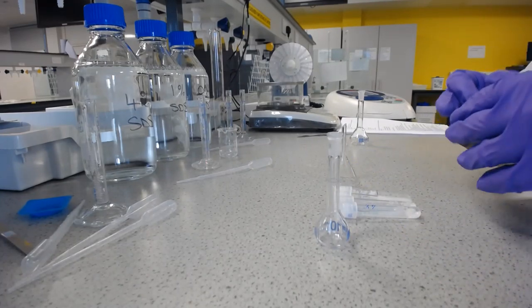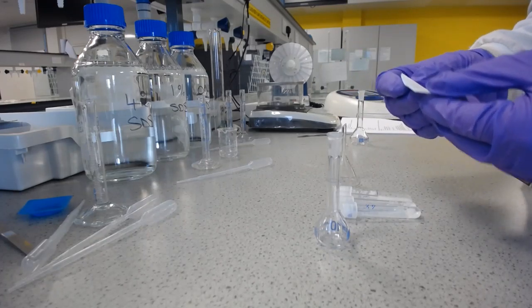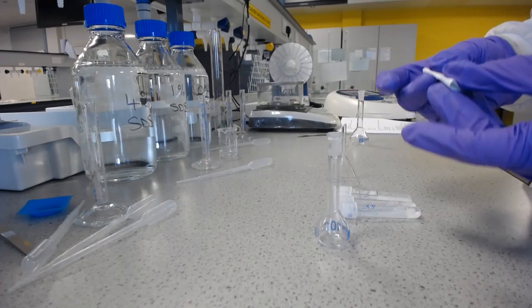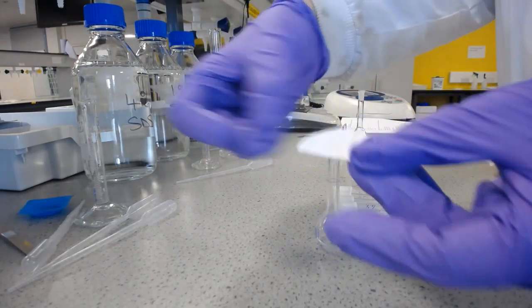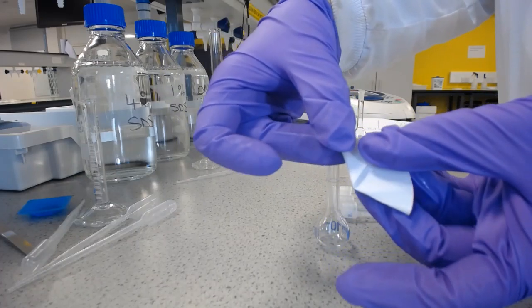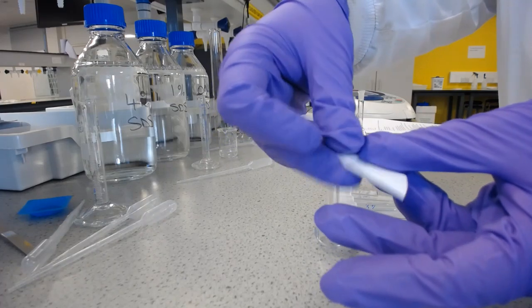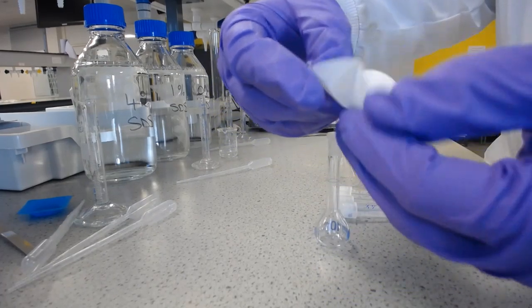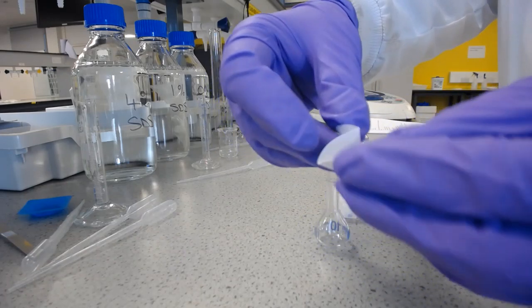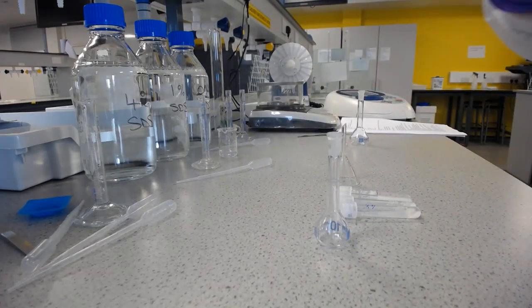So to make a cone of filter paper, you take a circle of filter paper, and one of the ways of doing it is to fold the filter paper in half, and then to fold over another section, like so, smaller or larger depending on the funnel. Then you can open it out again, and then you can use those pre-folded lines to flip it back in on itself to make a cone.